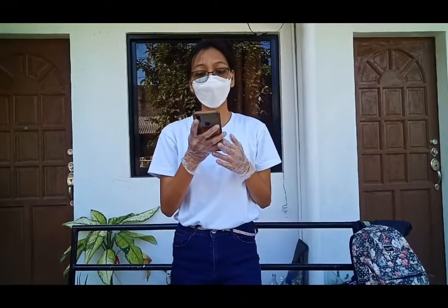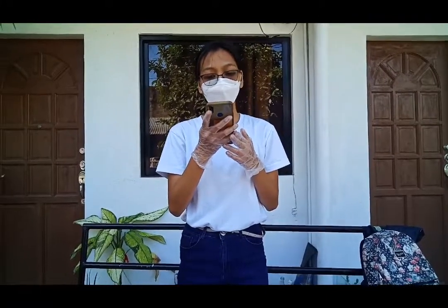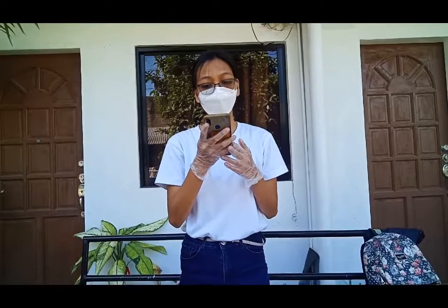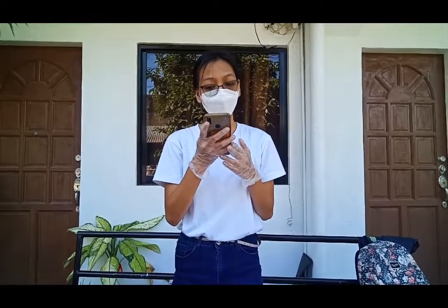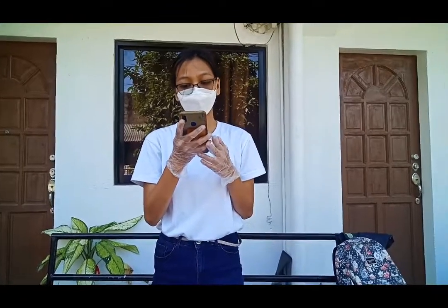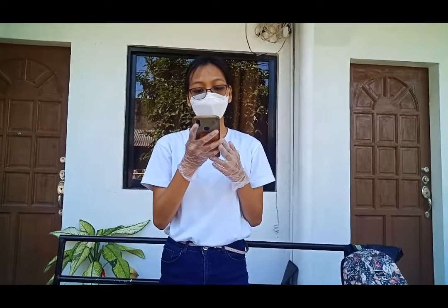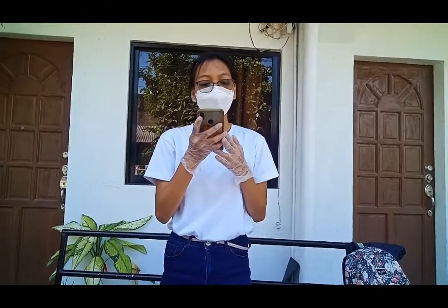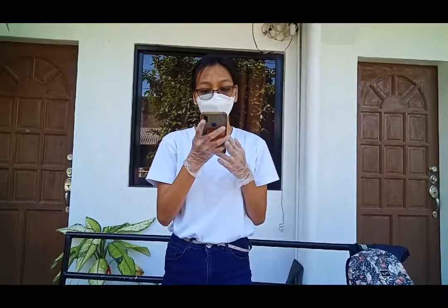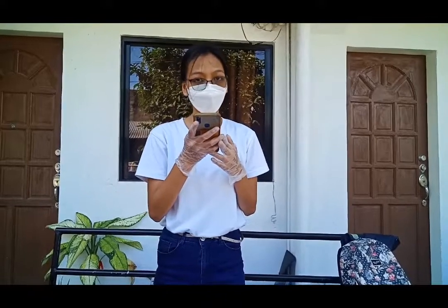We will proceed to laboratory 2, which is growing and examining culture media. Microbial development is influenced by various circumstances. To survive, it needs ambient circumstances that are conducive to its biological activities. Nutrients, the proper amount of moisture, pH, temperature, and pressure are also required for it to thrive. Microbiologists must simulate these requirements in laboratories in order to grow bacteria in artificial media.